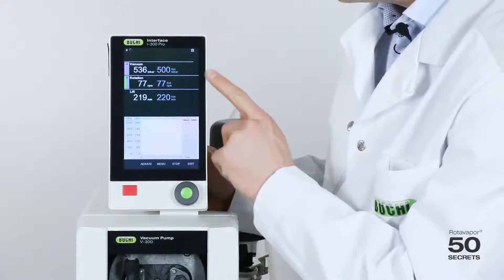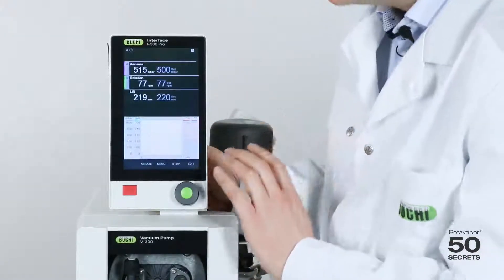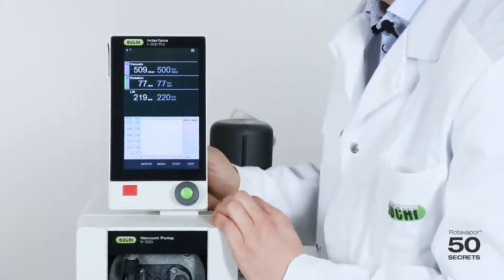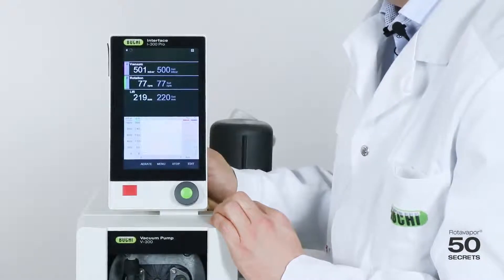So it will now reach 500 gently and you will not hear a lot now. It's only very, very gently. Exactly.